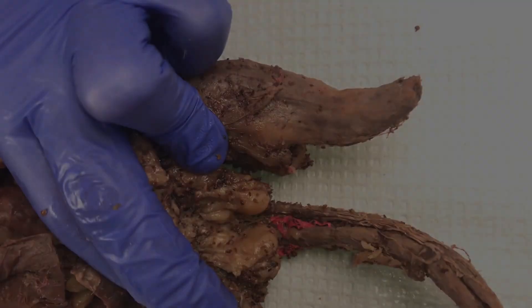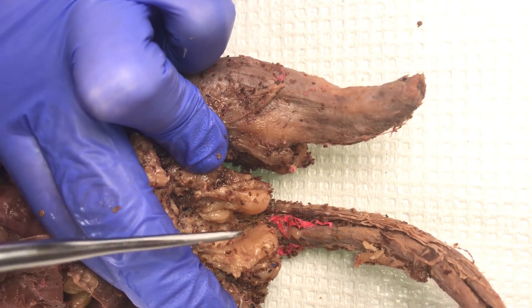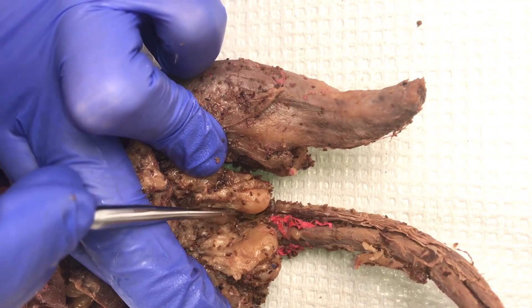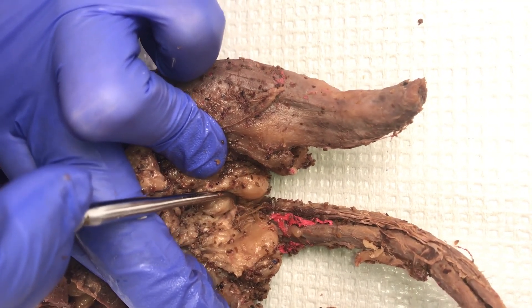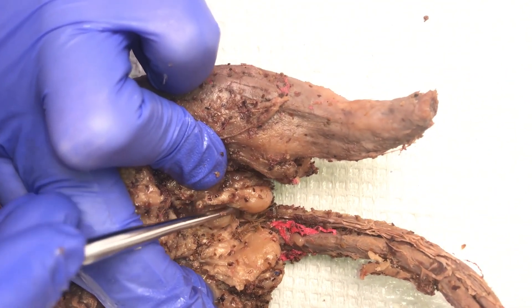For the female, we need to move some structures out of the way. Once the tissue has been moved, you can see the vulva and the opening to the vaginal canal.